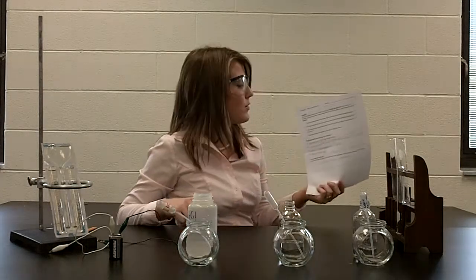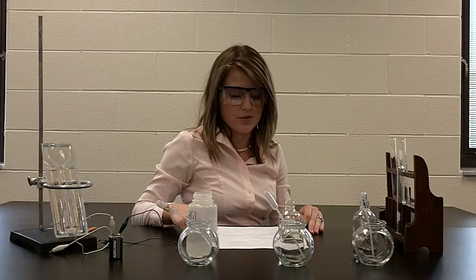This lab filming is for Uniota High School, the chemistry class, and we are going through our Chapter 1 Evidence of a Reaction lab with you. The purpose of this lab is to help you recognize the signs of a chemical reaction. We have 4 major things that happen as chemicals go through their reactions. These reactions take energy and result in different physical properties.